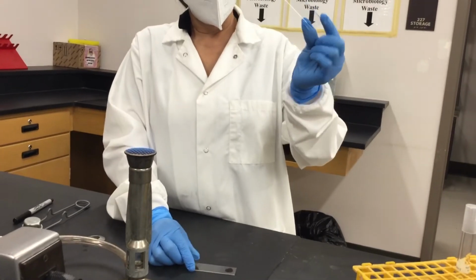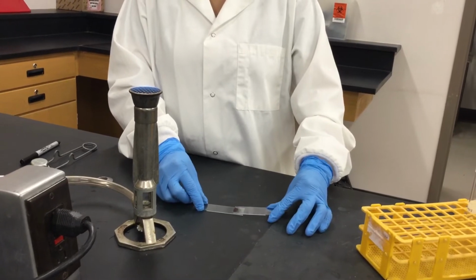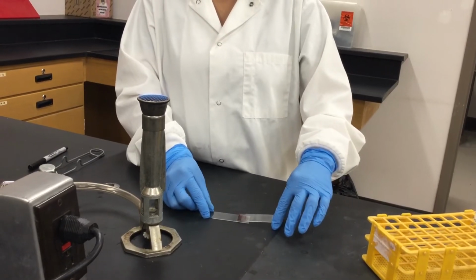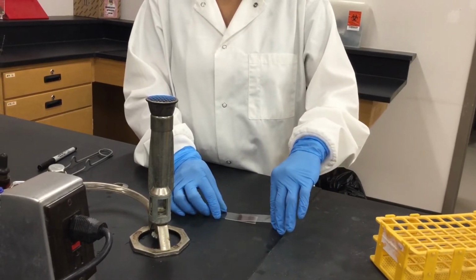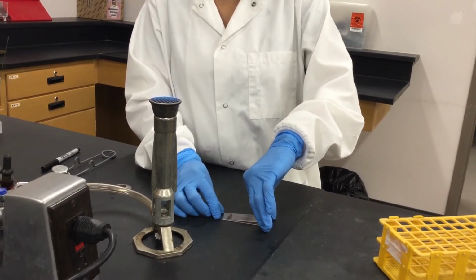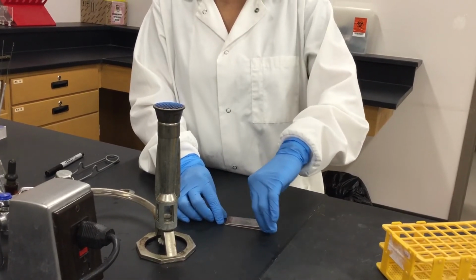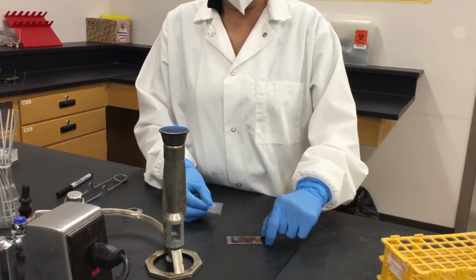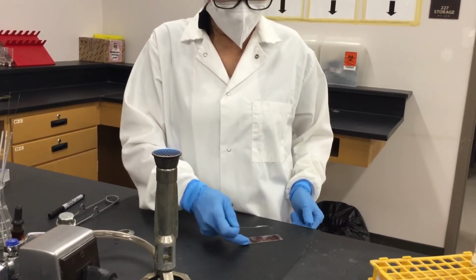and you grab your glass slide by the edge and this one on the bottom as well, almost 30 degrees. Drag it first to one edge and then continue. Carefully dragging up to that edge. You don't want to have your gloves filled with the bacteria. Now, this is more or less how it looks.